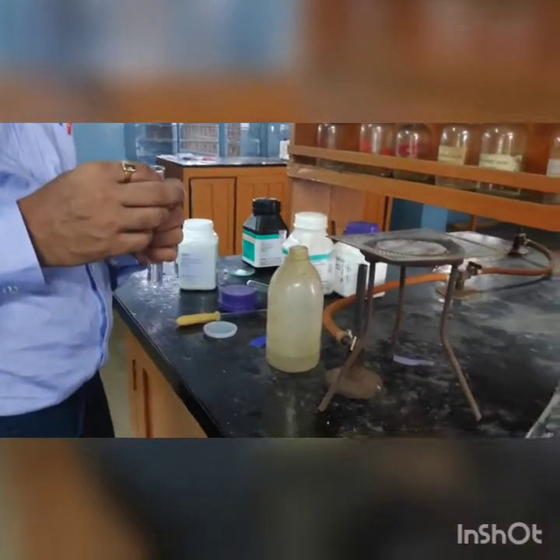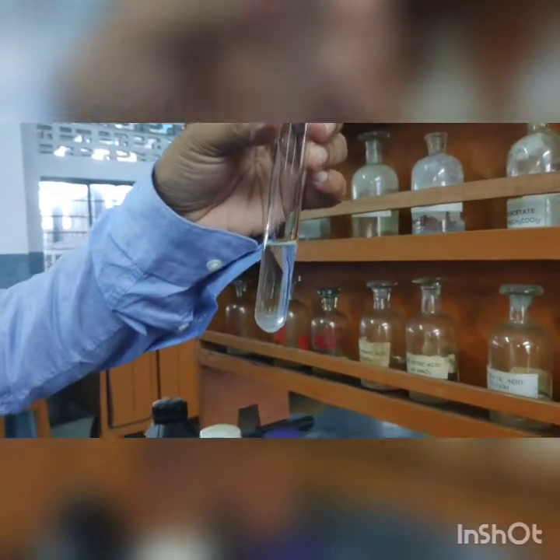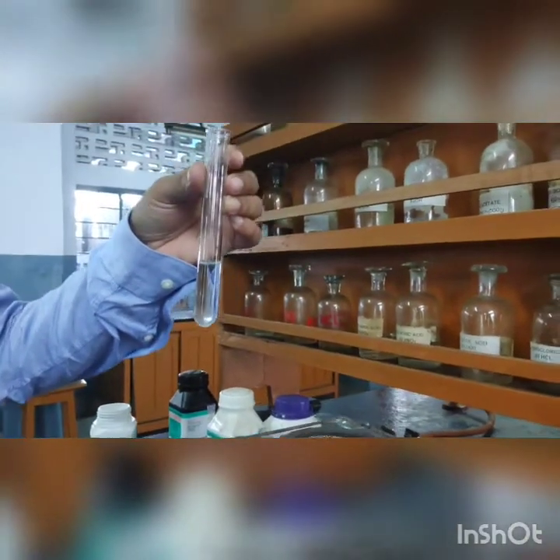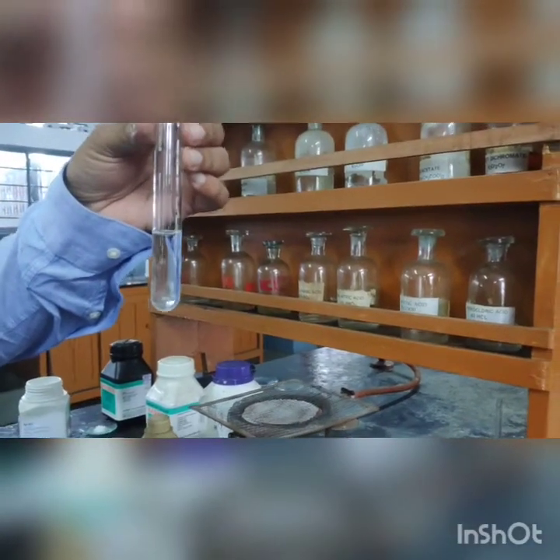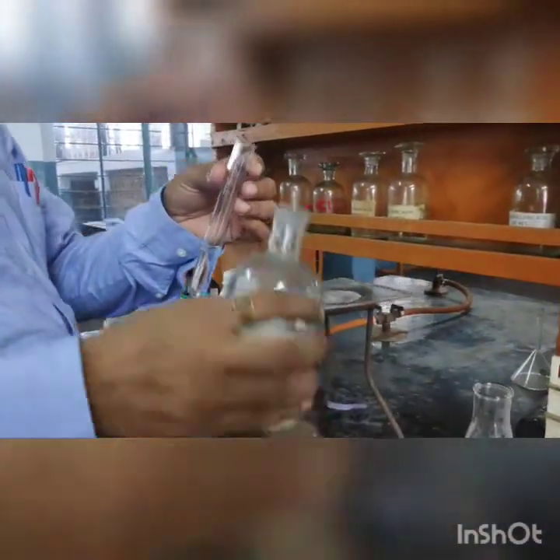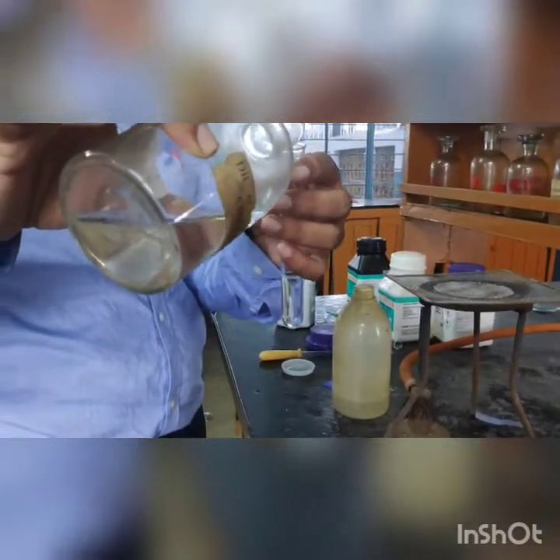Sir has taken the cooled filtrate from the conical flask into a test tube. Since we are going to first test for the sulfate radical, we will not add sulfuric acid. Instead, acetic acid will be added — a little amount to neutralize the effect of the base due to the excess sodium carbonate.